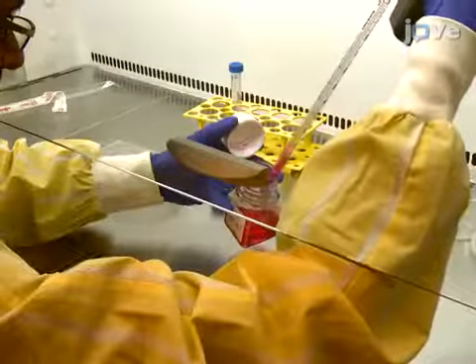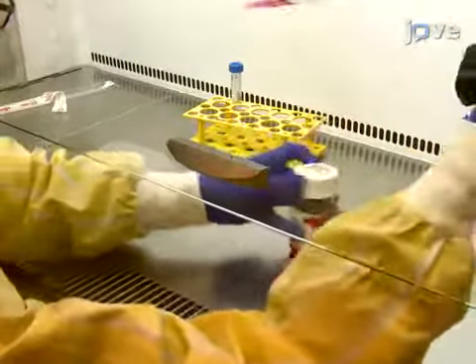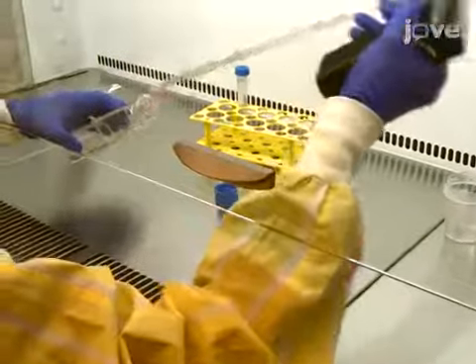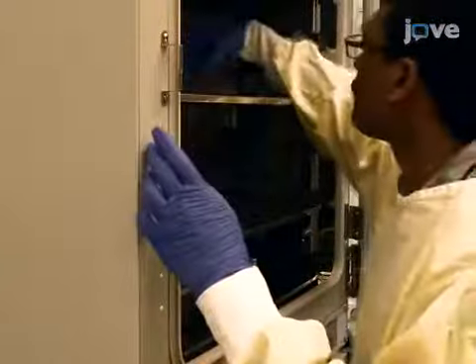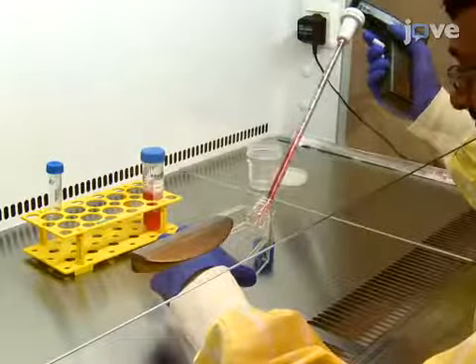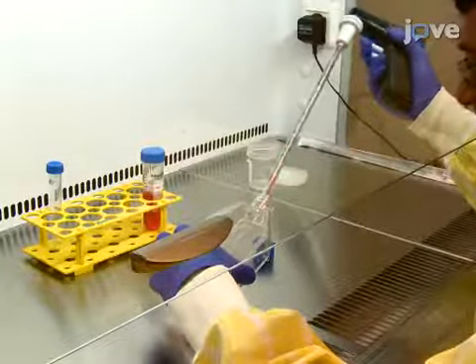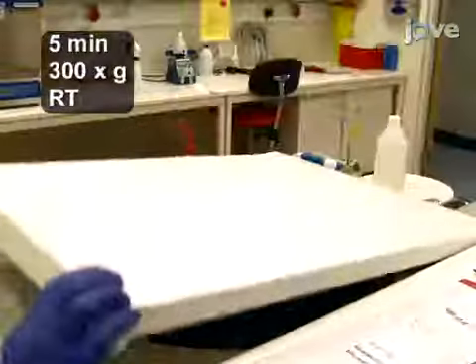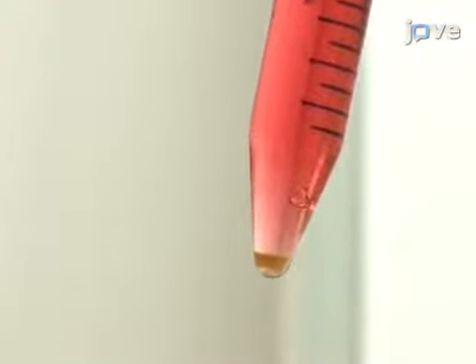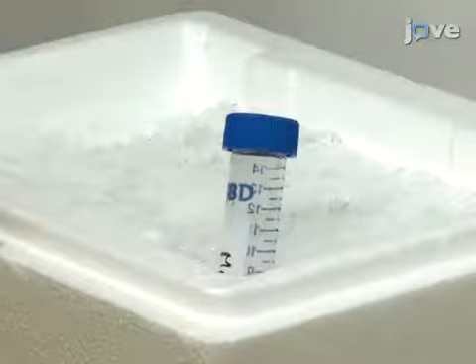To prepare collagen-embedded fibroblasts, begin by treating lung fibroblast cells with trypsin for 10 minutes at 37 degrees Celsius. When the cells have detached, stop the reaction with 8 milliliters of complete DMEM and then spin down the cells. Resuspend the pellet at 230,000 cells per milliliter in fresh DMEM and place the cells on ice.